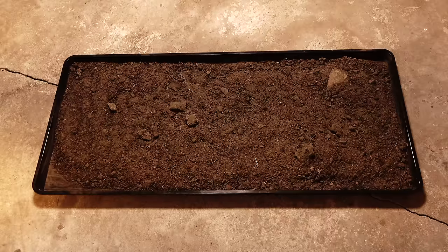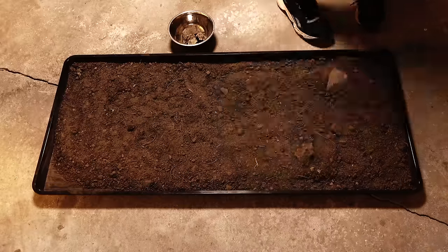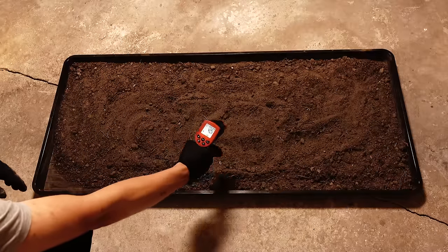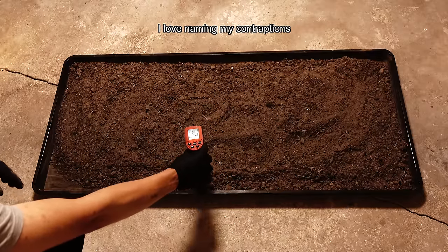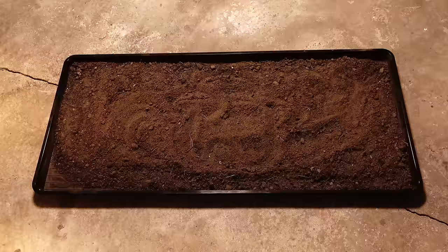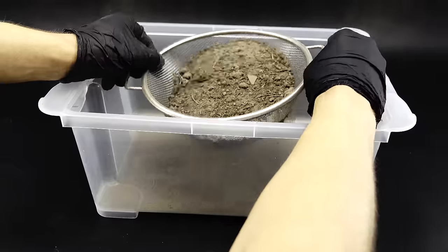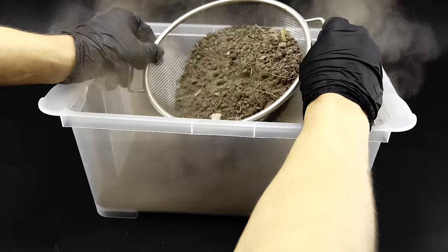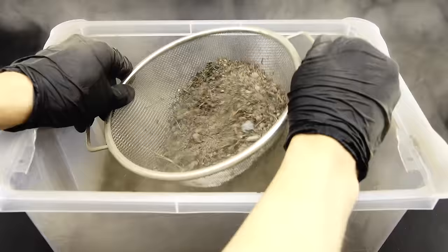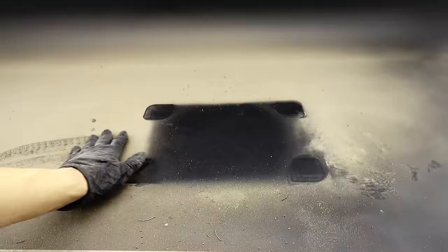The black plastic absorbs a ton of light, turning it into heat, which quickly drives off all the moisture from my dirt. After just a few hours, everything was bone dry. I brought the tray into the lab since outside it was way too bright for my camera, then manually got out all the larger rocks and other stuff contaminating my dirt. I also measured its temperature, and it turns out that the genius tray sun heater 5000 was really efficient, heating up the dirt to 40 degrees Celsius for free. To further purify the silicon dioxide, I have to pass all this dirt through a sieve, which is a rather tedious process that produces copious amounts of dirt dust, which behaves kind of like a gas. Not even halfway into this project, I created some nasty lung and background destroying thing.